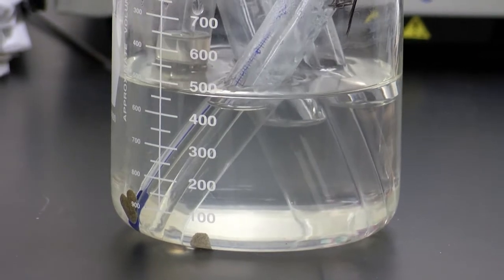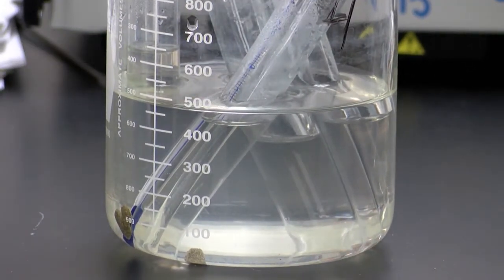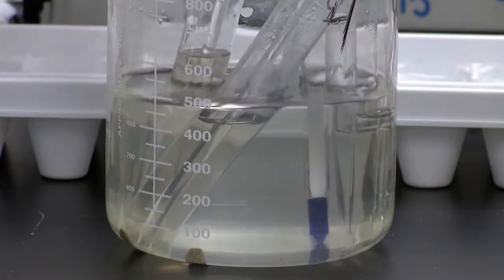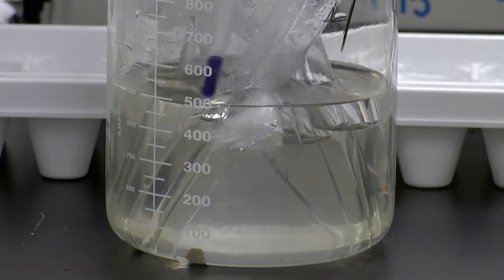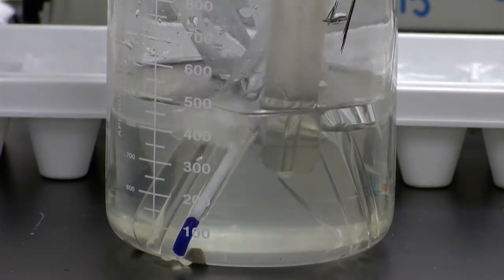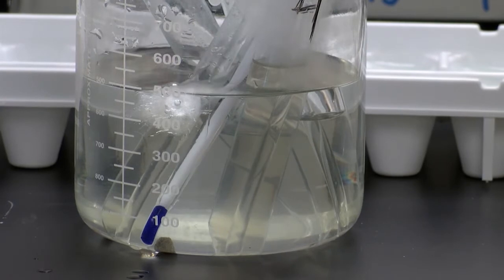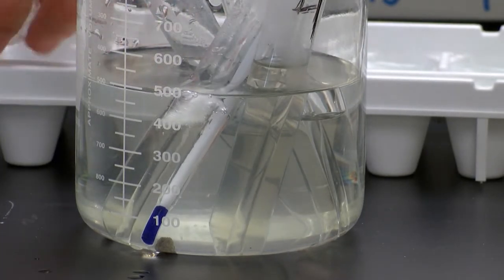So I'm going to speed up the process a little bit by adding some ice so we can get this cooling going. Make the water a lot cooler. And we are looking at the 15-gram test tube, hoping that we will reach the point at which 15 grams in 10 mL of water will start to fall out of solution, as we call it.